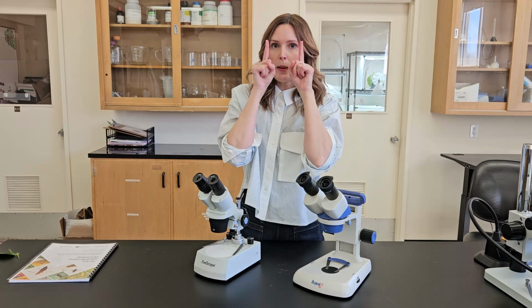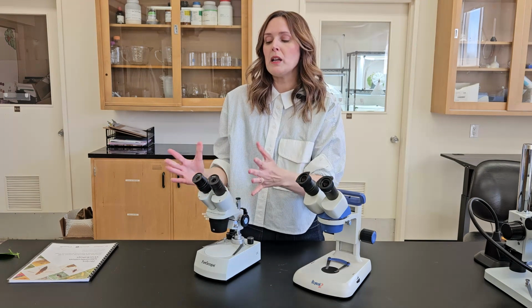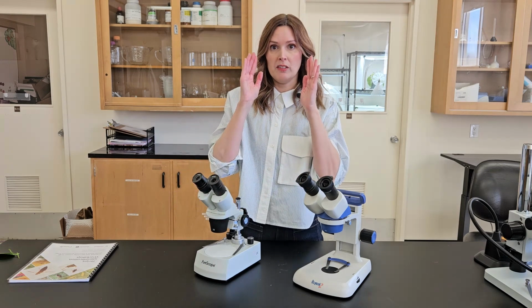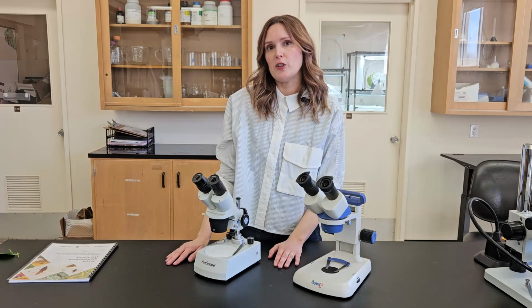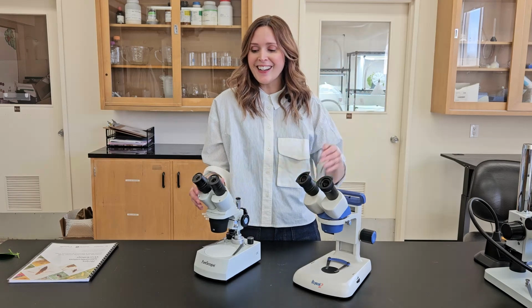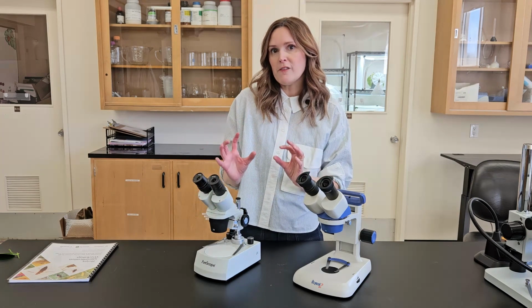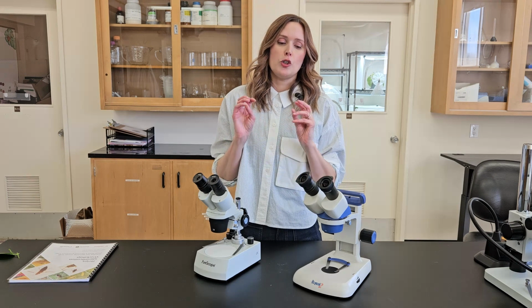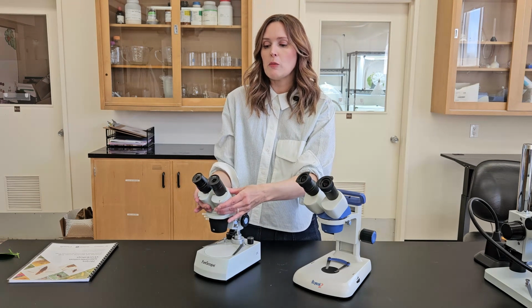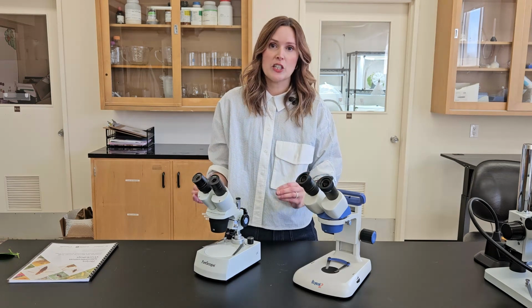To make sure you're at the middle focus part of your pupils, you want to be able to line these up. And you'll be able to tell really quickly when you start using a microscope that both are in line with both of your eyes. I think a lot of people, when they first start using a microscope, tend to use their dominant eye, which for me is my right, and then just ignore their left eye, or close one eye. But when you get them both in line and they're both in focus, it makes such a difference to the detail that you're seeing with your microscope. So I encourage you to look for ones that can swivel like this. And when you go to use it for the first time, make sure you are focusing on something and practicing using both eyes.